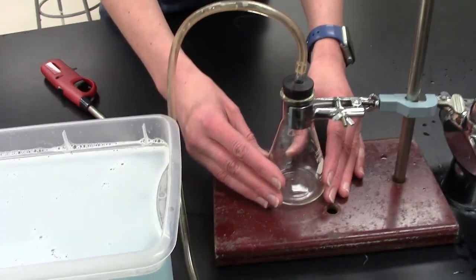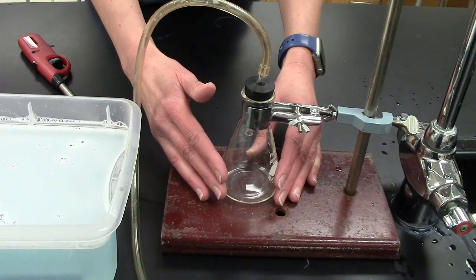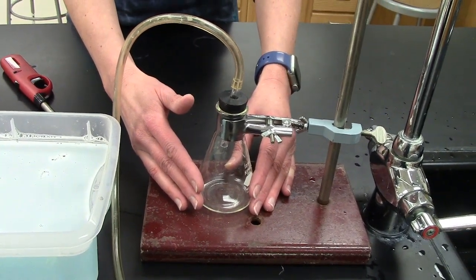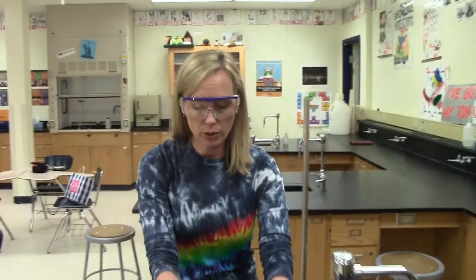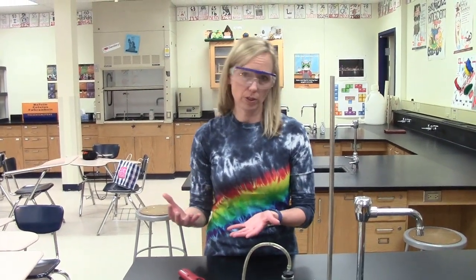And as this goes on, the zinc and the hydrochloric acid should chemically react with each other. And as we talked about with the Barbies, usually we have one element kick out another element. So in this case, the zinc is going to be able to kick out the hydrogen that's a part of the hydrochloric acid. Well, this is pretty cool because that means the element that's coming out as a product is hydrogen gas. And as we've talked about before, hydrogen gas is flammable.